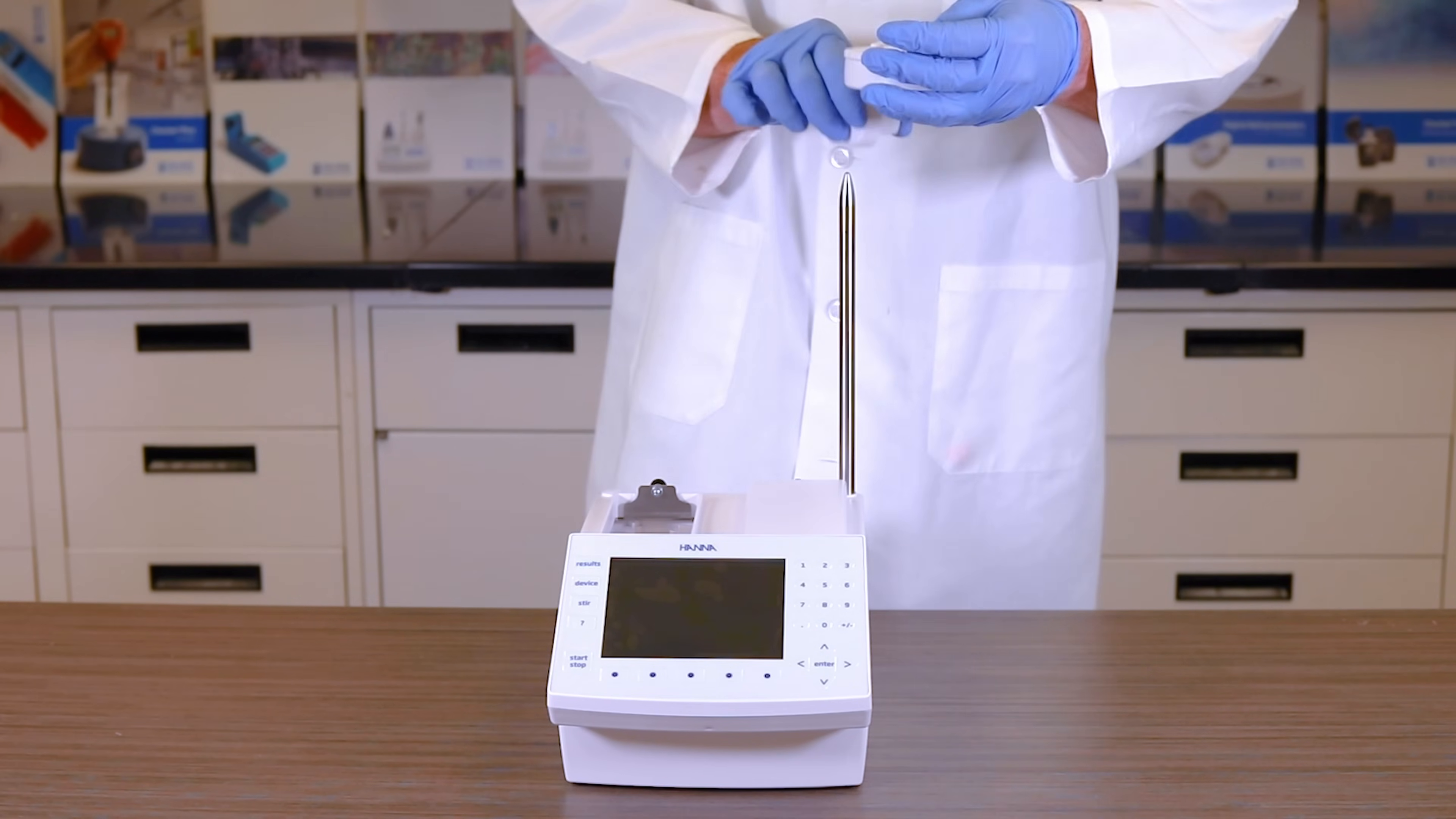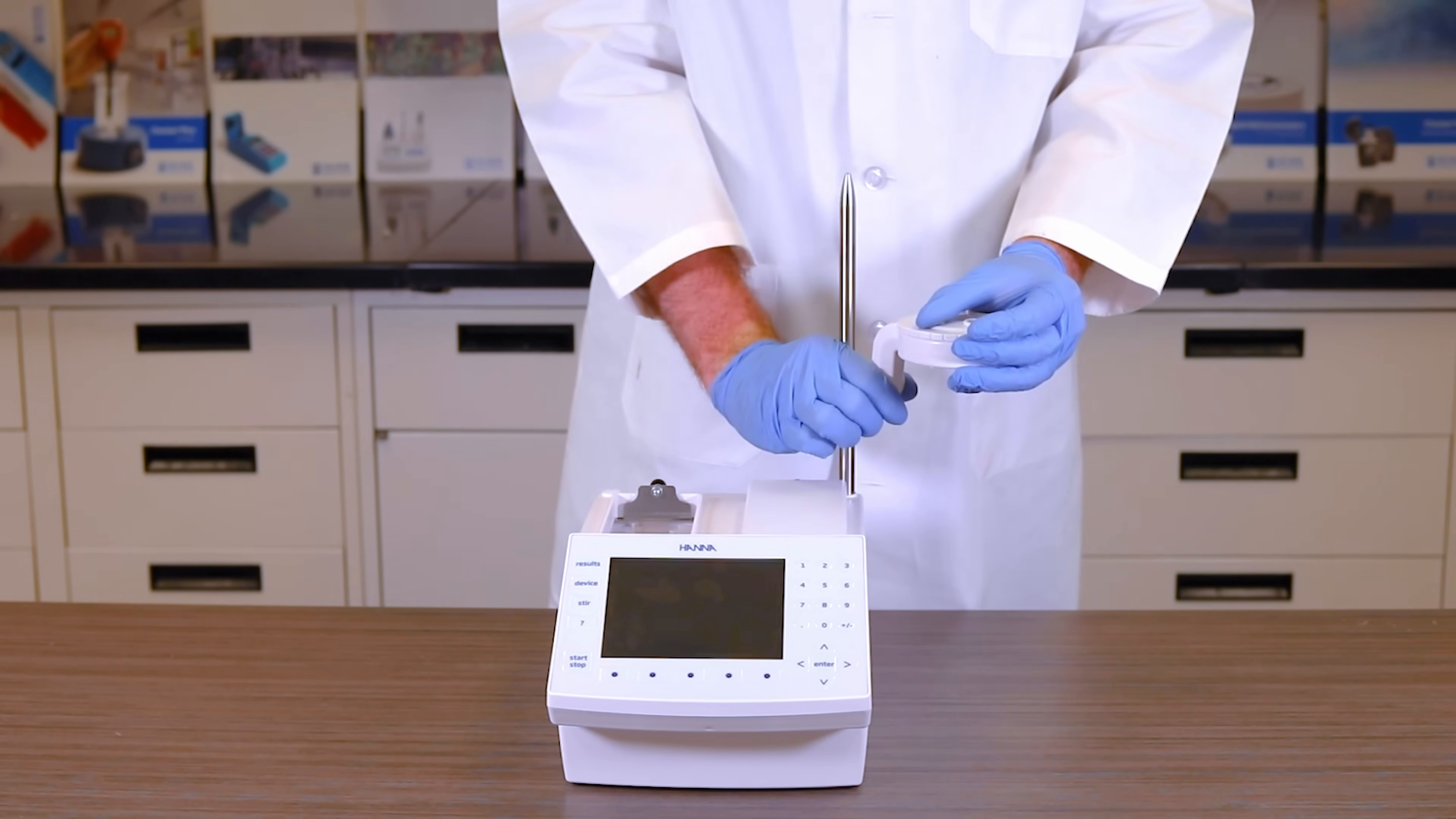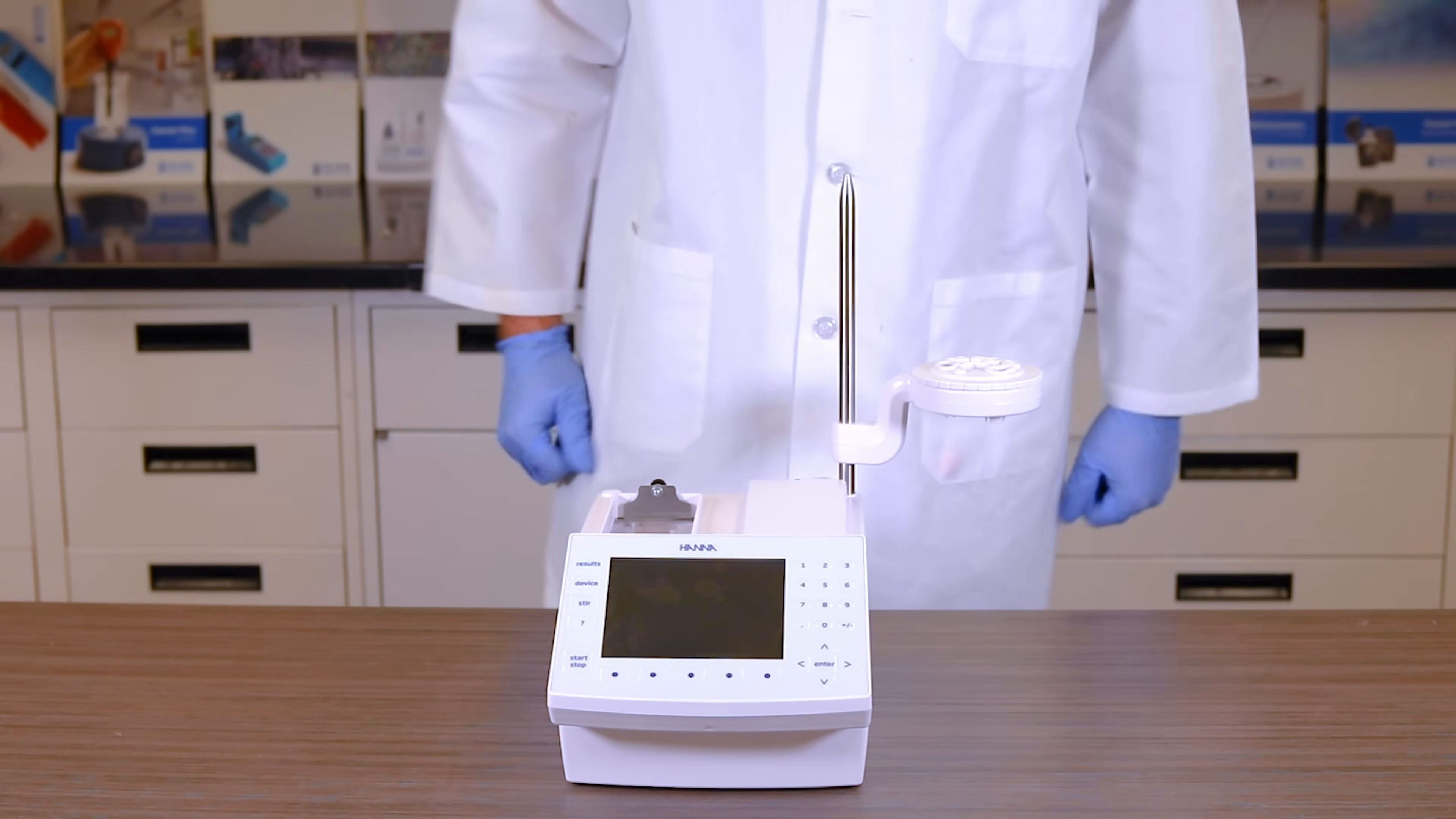Locate your plastic assembly holder. Orient the holder so it's in the down position and slide onto the steel assembly rod.